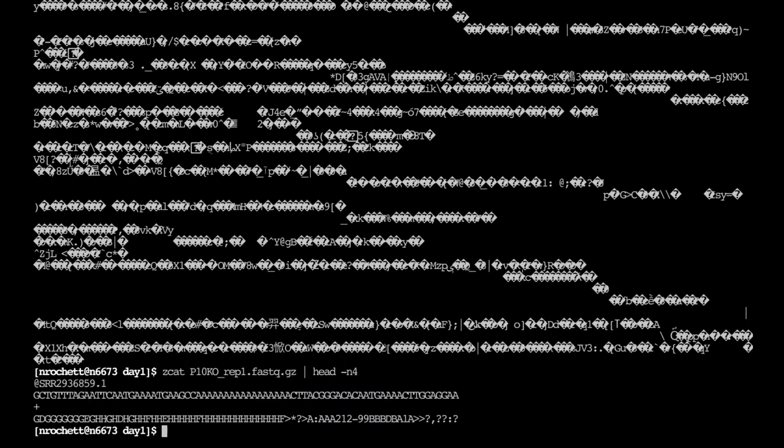The other way you can do things is just unzip the file entirely. But it's not very good practice to unzip the files entirely. It's better to do it on the fly within a pipe construct, because unzipped files are going to take a huge amount of space on your disk, and disk space is maybe the biggest issue in managing a big bioinformatic project. So generally, you don't want to unzip your files because it's going to create even more problems. Although you can always zip and unzip the files back and forth, and no data is lost. It's a lossless compression.